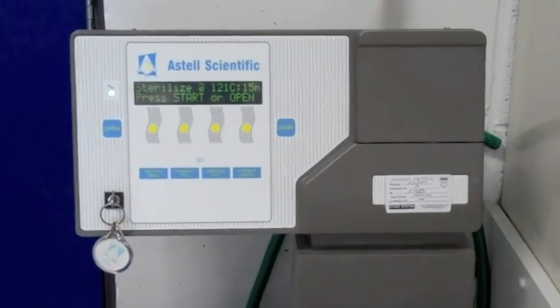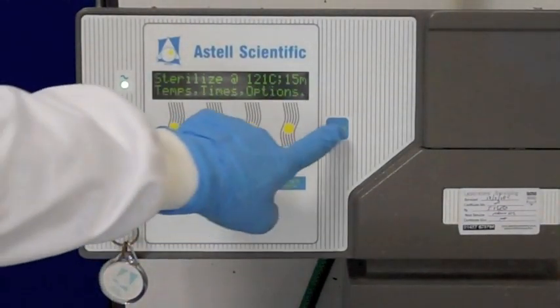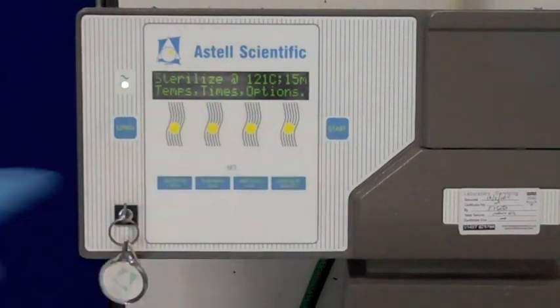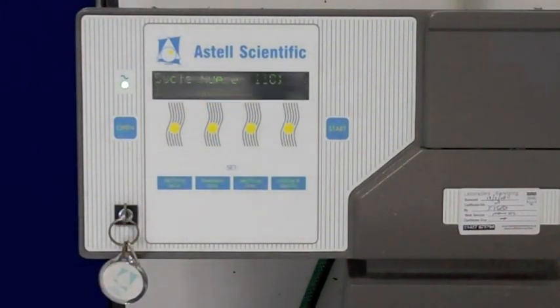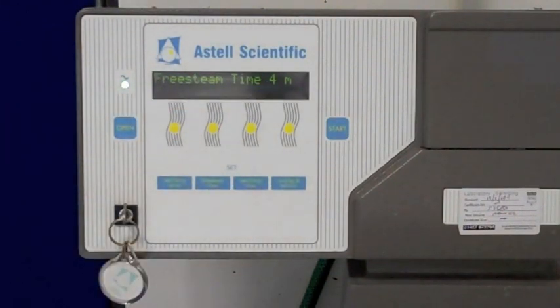So zoom back in again. And quite simply press the start button. You'll hear the beep. And that means that the autoclave is now starting. And it will give you a cycle number, one three eight one, it said before it disappeared there.